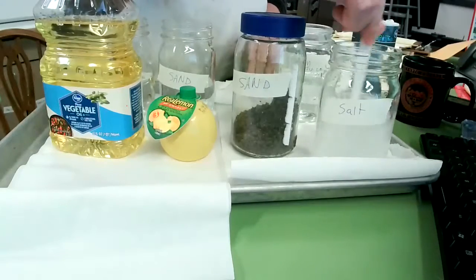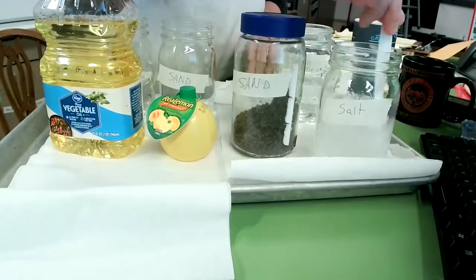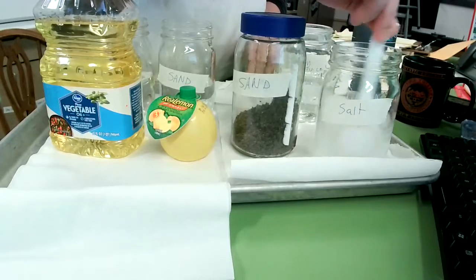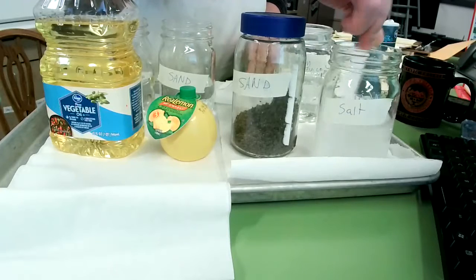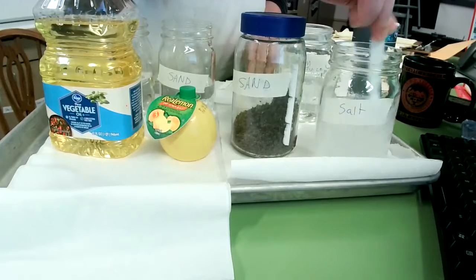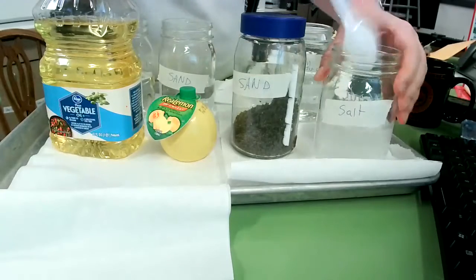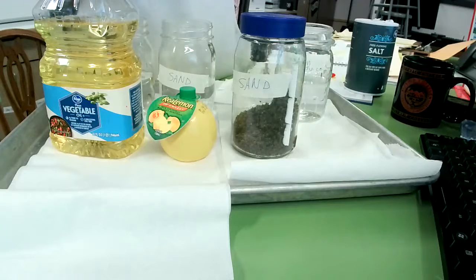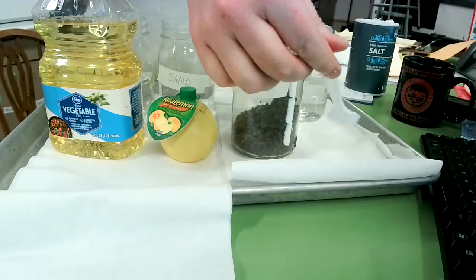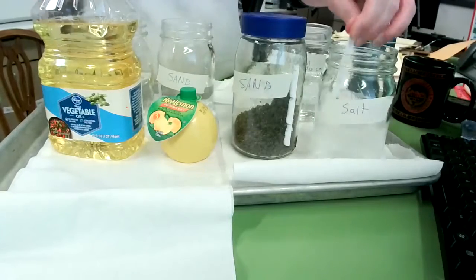Remember, we watched a little video where they talked about there are ways to increase dissolving. And one of those things that can increase how fast solute is dissolved is heat. If we were to have hot water here, it would dissolve much, much quicker if it is going to dissolve at all. So let's see if I have any left in there if I need to. Okay. Nope, I need to stir a little bit more. Okay. That was only about a minute, so we're going to keep stirring.